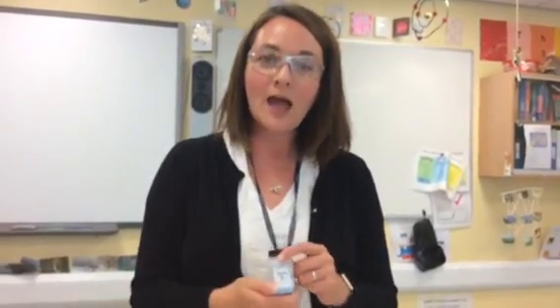Okay, hello Year 10. We're back again looking at reversible reactions. So remember, the first reversible reaction we looked at was ammonium chloride. We had a white solid, we heated it, and then we were looking to see what happened further up the boiling tube and being able to explain what happened in terms of reversible reactions.